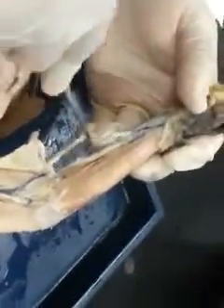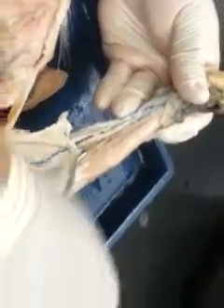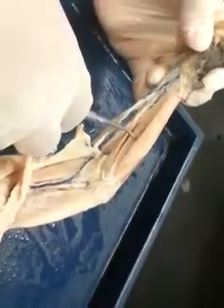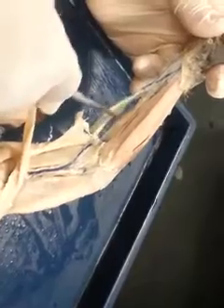As far as the forearms, on the ventral aspect, we're going to include the brachioradialis here. So you would have the brachioradialis, and then you would have the pronator teres. Remember, the pro bends just like the pronator teres does. So that would be the pronator teres. The flexor carpi radialis, right, that guy there. The palmaris longus, and then the flexor carpi ulnaris. Right there. So flexor carpi ulnaris, palmaris longus, flexor carpi radialis, pronator teres, brachioradialis.